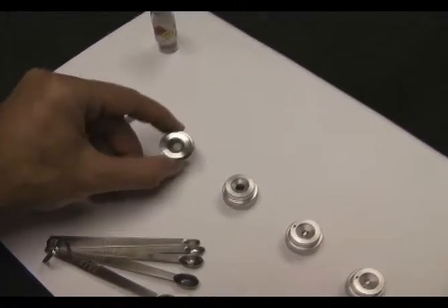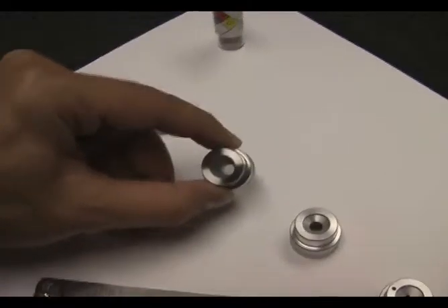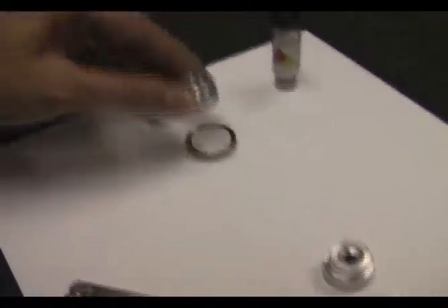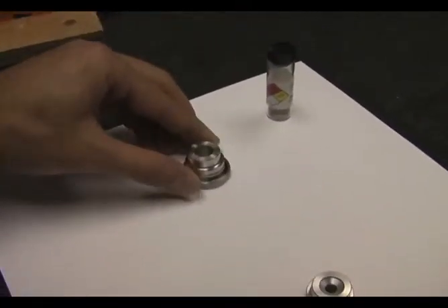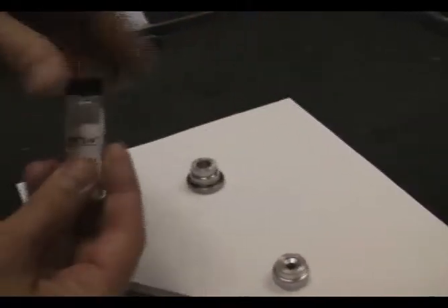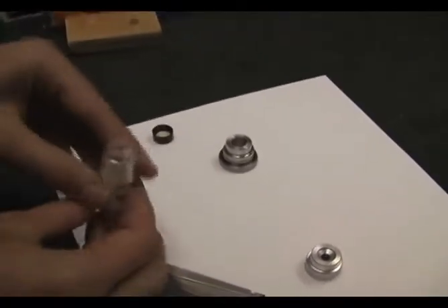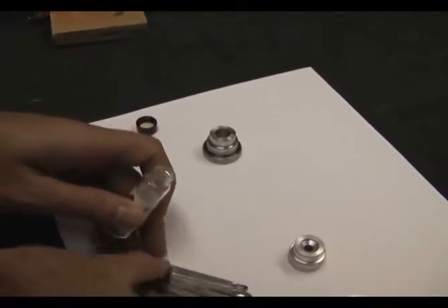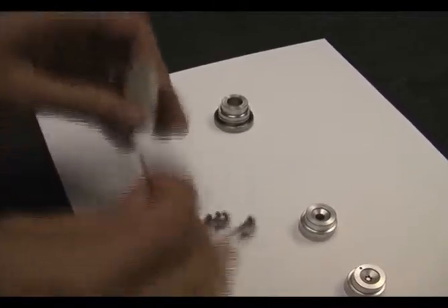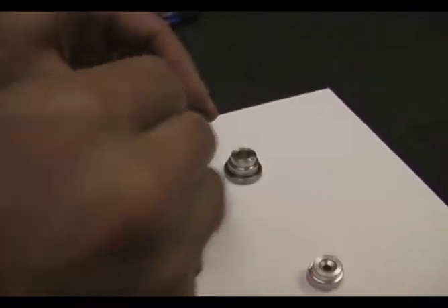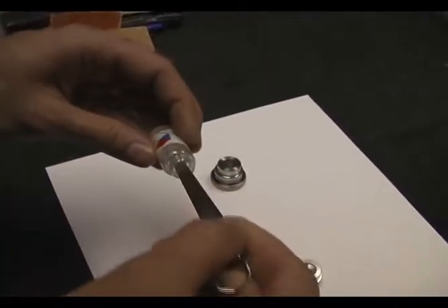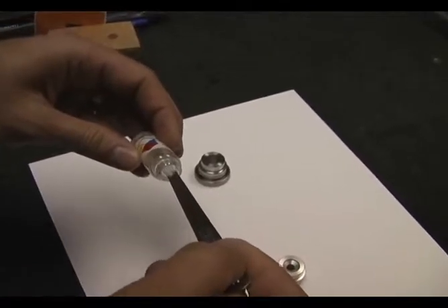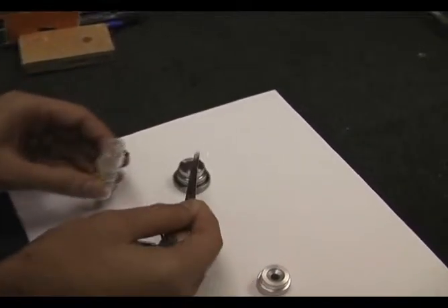Then you follow up with the sample holder, which is just a piece of metal with a hole in it. Then using one of the provided spoons, you collect a bit of your dust and position it inside the chamber.